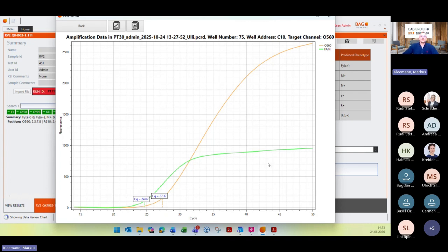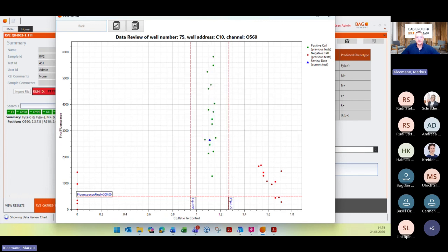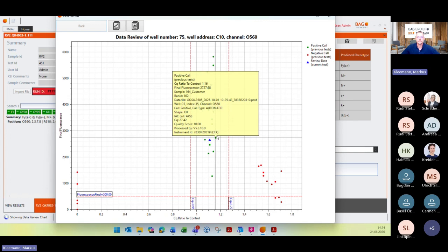So PlexTyper calculates with 3 different parameters which are important. One is the CQ ratio of the target, and the target CQ is divided by the CQ of the internal amplification control. So for example, 27.37 with 24.67. And then you will see, when I go back to the top of this window, the CQ ratio to control, which is 1.11. And this has to be located between the minimum and the maximum target CQ ratio threshold, which is between 0.95 and 1.27. All these reactions here are located in this area. So for example, this one here has a ratio of 1.16 and so on.